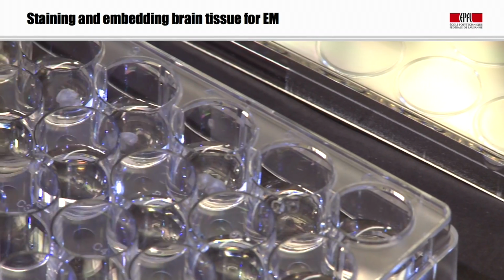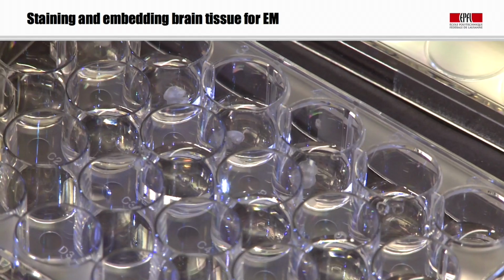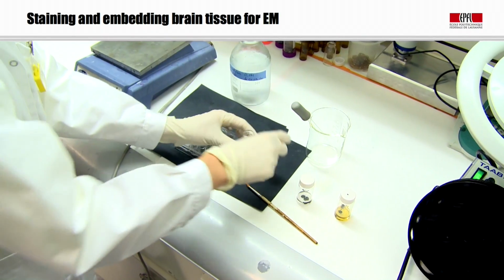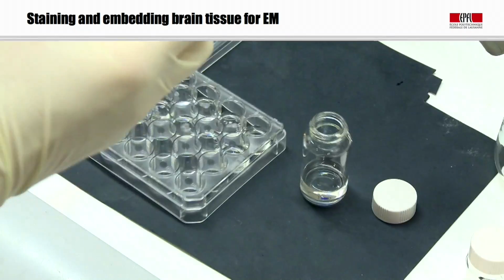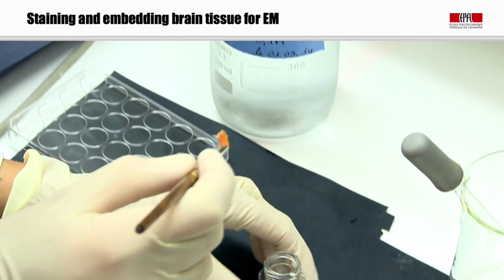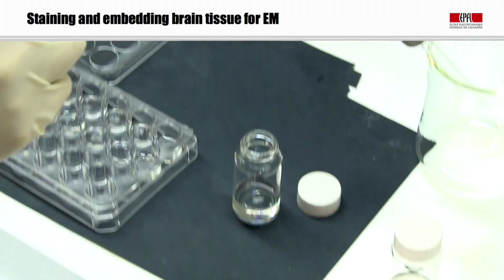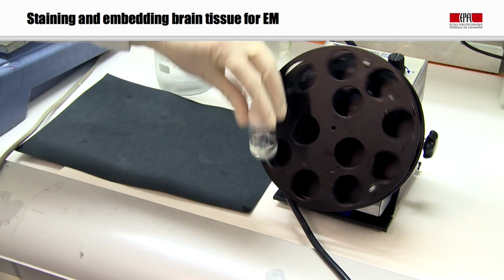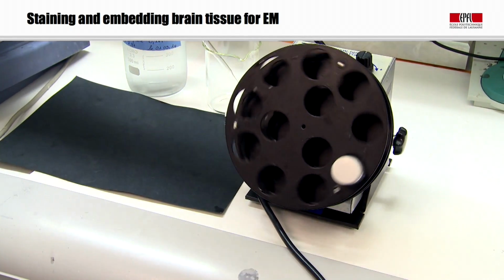So these are placed into wells, these plastic wells, which we can image very easily under a dissecting microscope. And we can select the sections that we want. And the process now is to first of all wash the sections in buffers like cacodylate buffer, which we use a lot for electron microscopy, which are very non-reactive to some of the later contrasting agents that we use. And of course all this work is done in a fume hood.